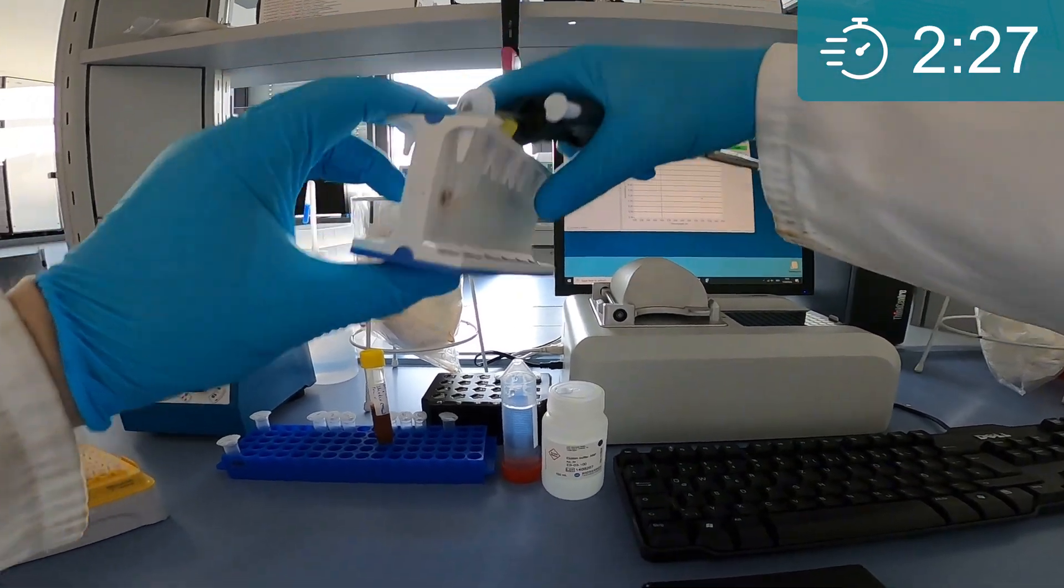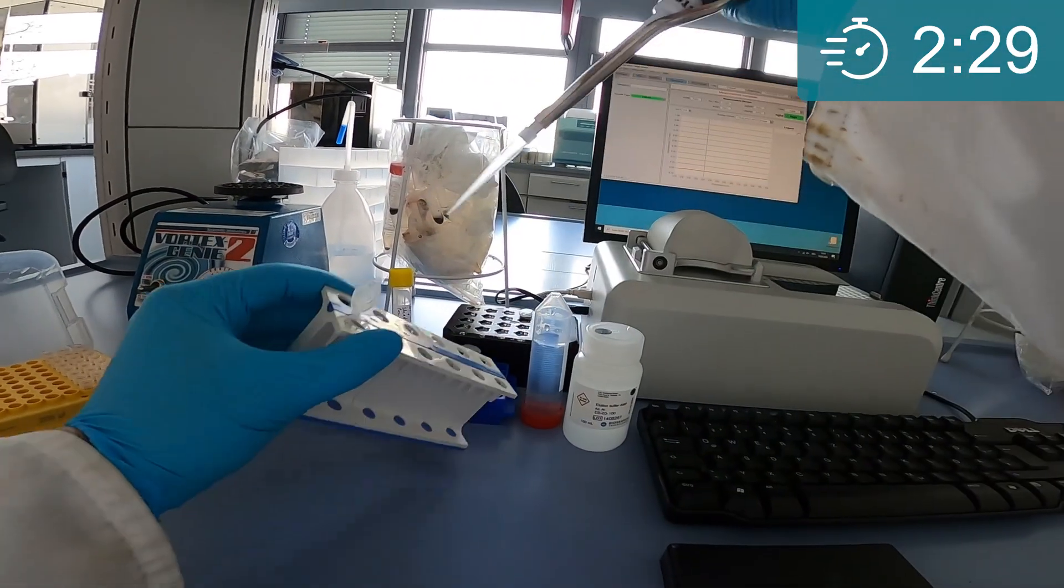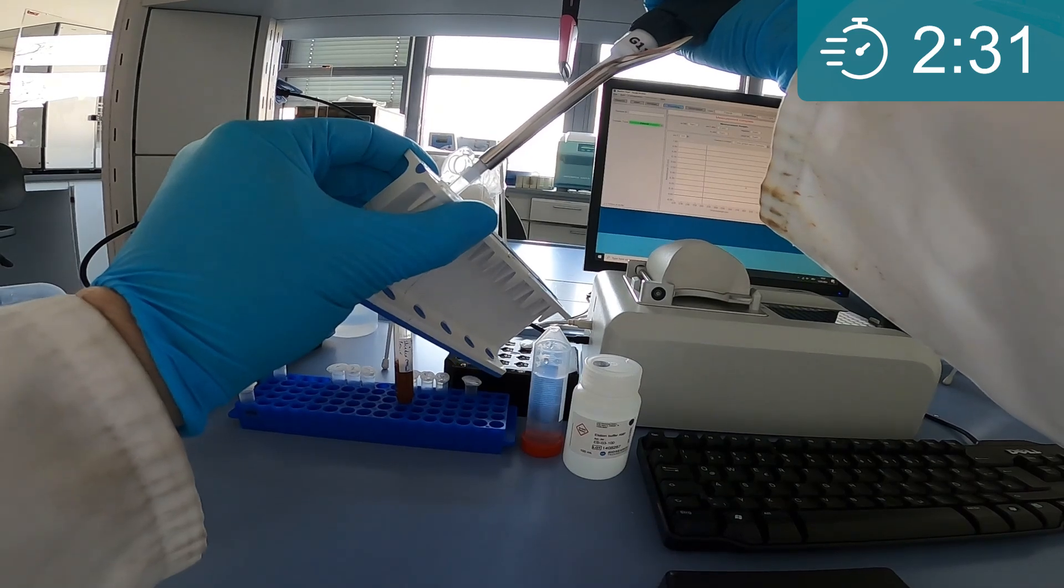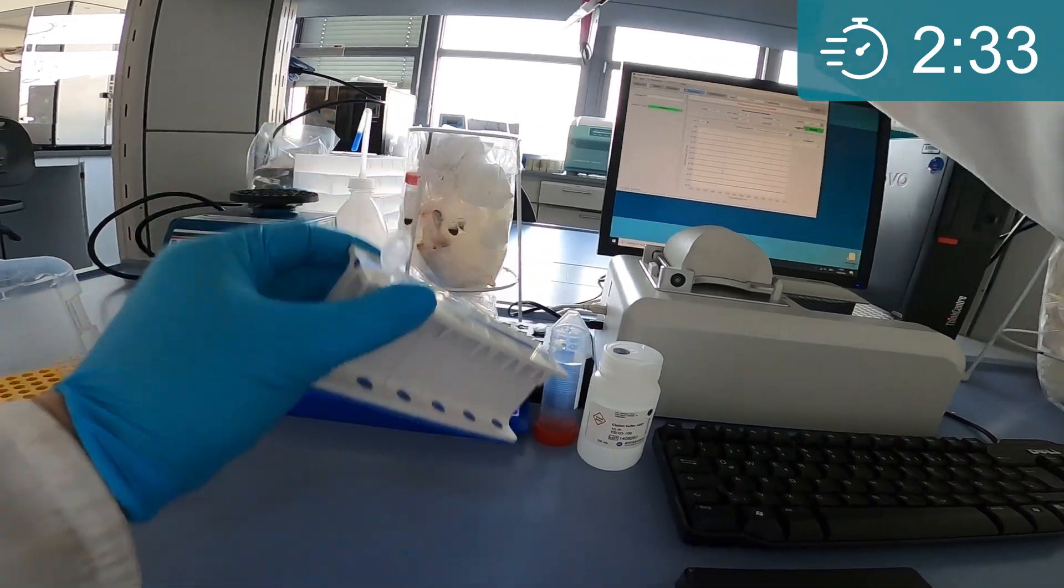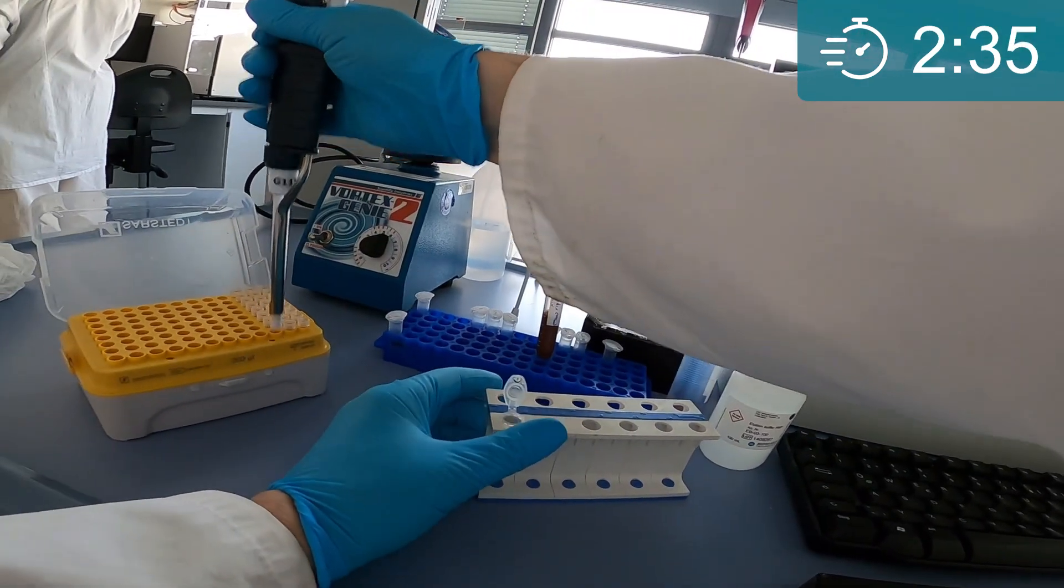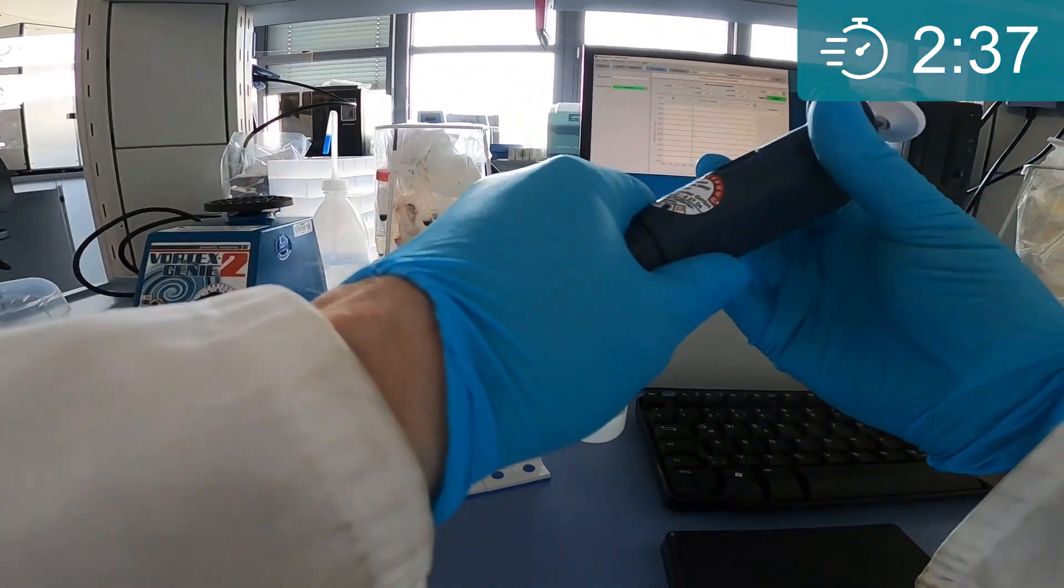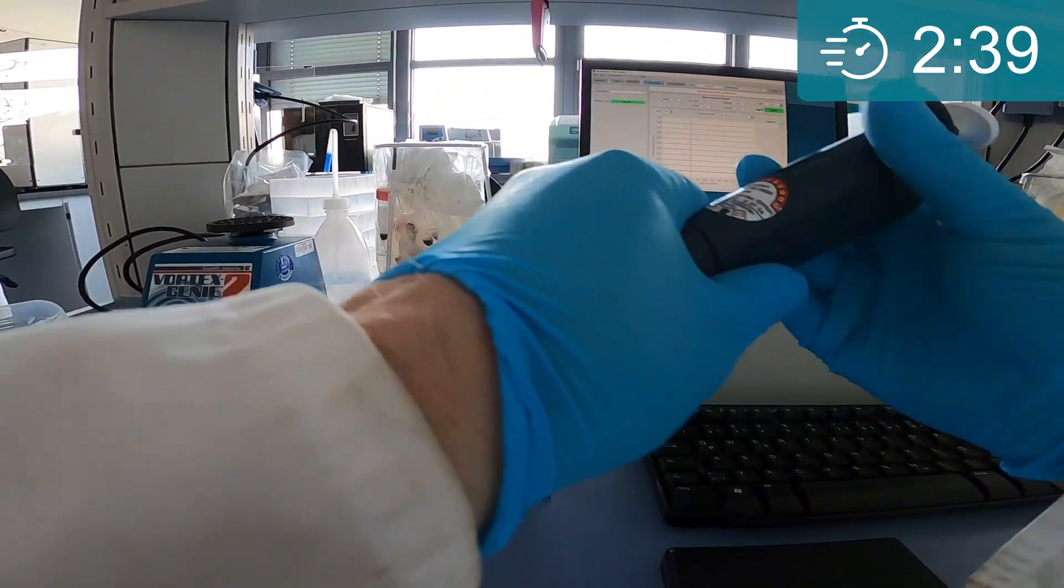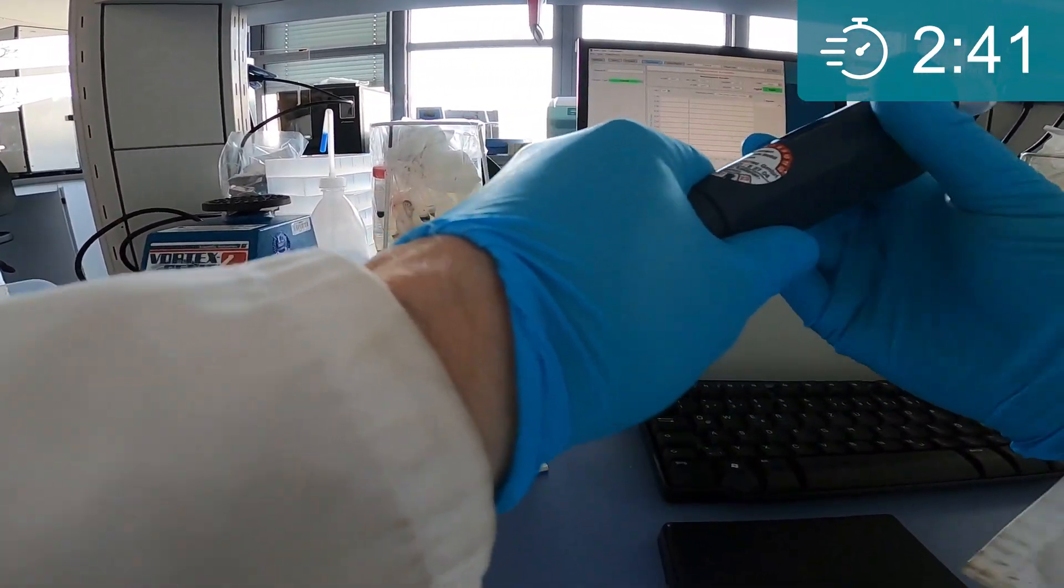You need to remove as much wash liquid as possible to avoid carryover to the elution step. However, slight carryover shouldn't harm the process as the water does not contain inhibitory substances. Only one water wash is sufficient to obtain pure DNA.